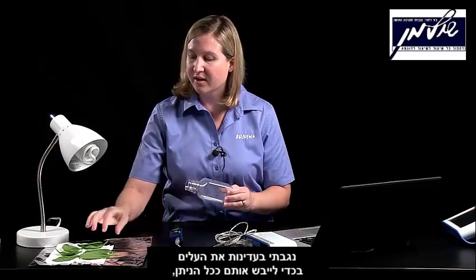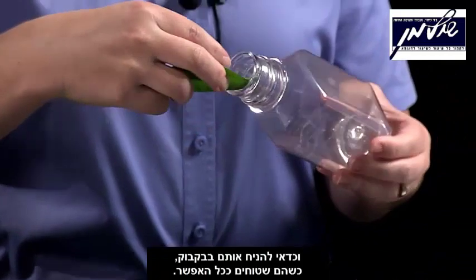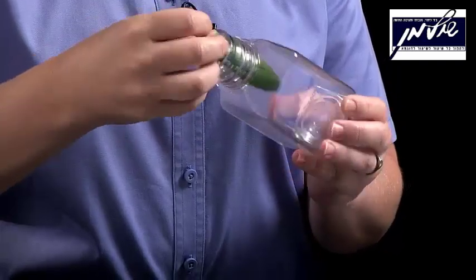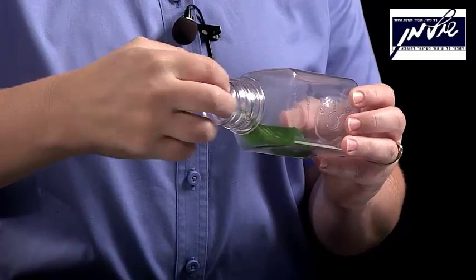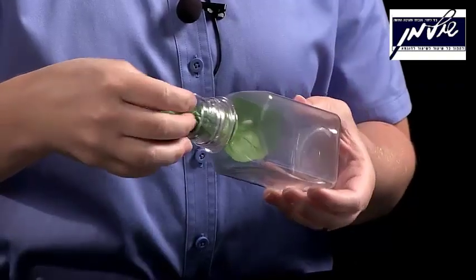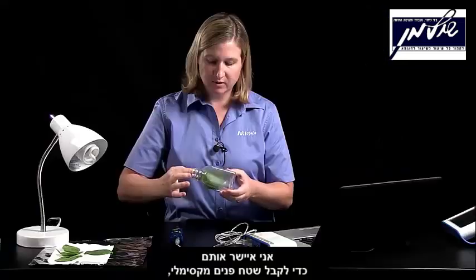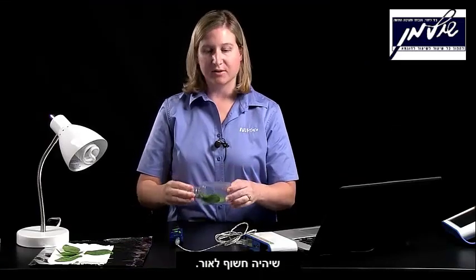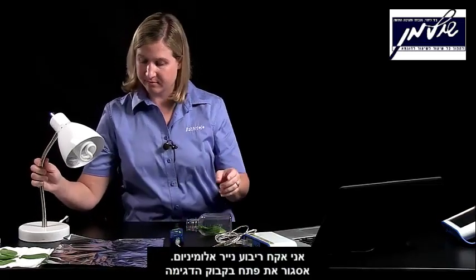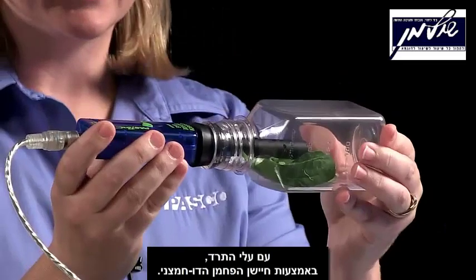It just depends on the size of your spinach leaves. I've gently blotted the leaves so that they're mostly dry, and ideally we would have the spinach leaves lay flat. So I'm going to put spinach leaves through the opening of the bottle, and I'll go ahead and put a second one in. I'll lay them flat to get the maximum amount of surface area exposed to the light. Then I'll take a square of aluminum foil.